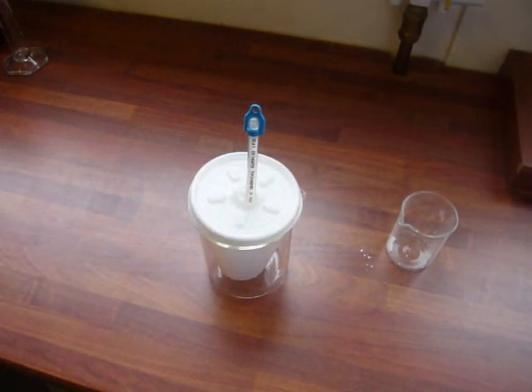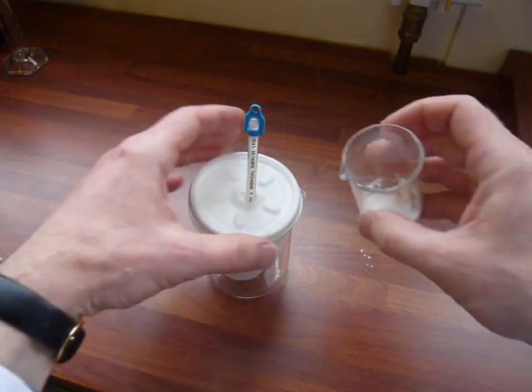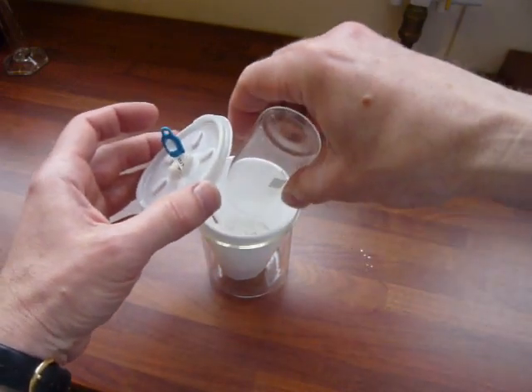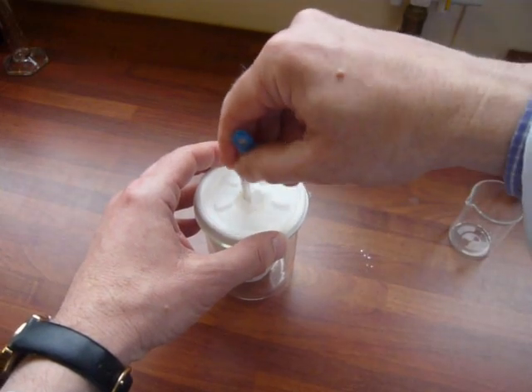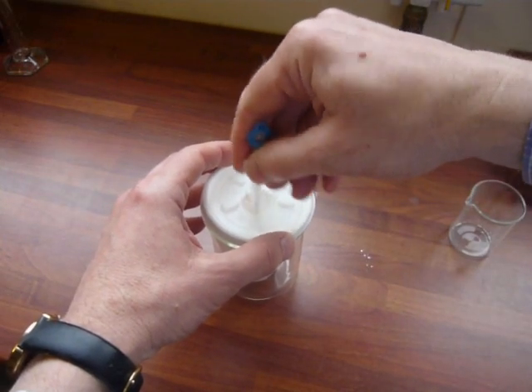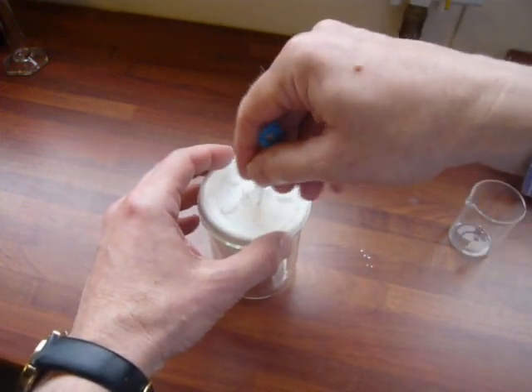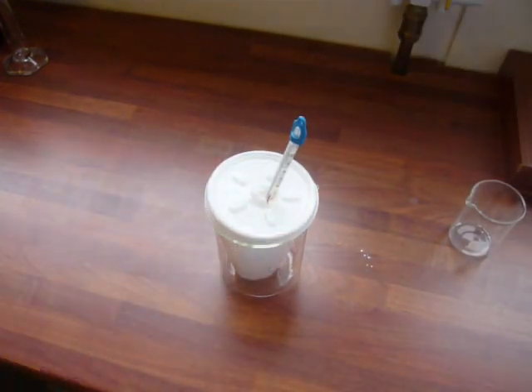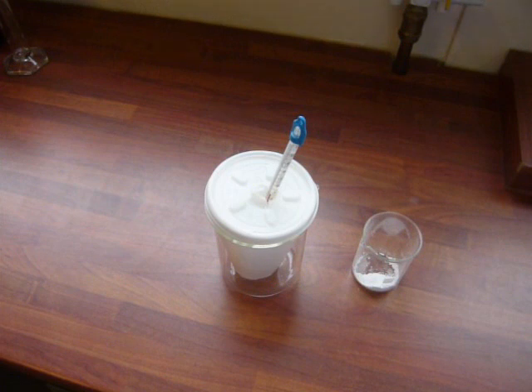Now, in a typical exam question, they often then continue to add the calcium hydroxide, or whatever the reactant is, so that you get different temperature rises depending on how much of the solid you add. So I've added another batch of calcium hydroxide, give it a good stir, and the temperature rise this time is 40 degrees, and we can carry on doing that, adding extra portions of the solid calcium hydroxide each time, and measuring the temperature rise.